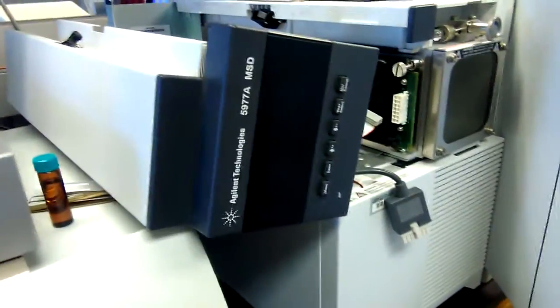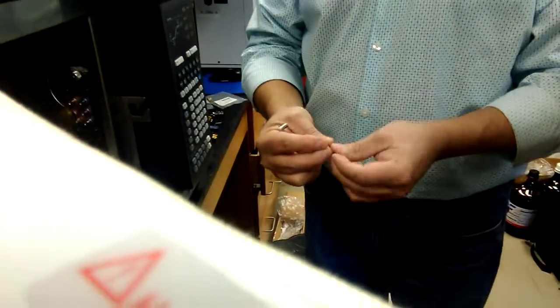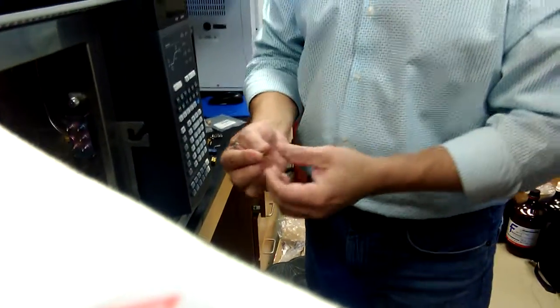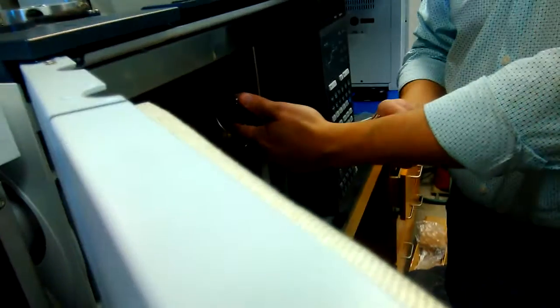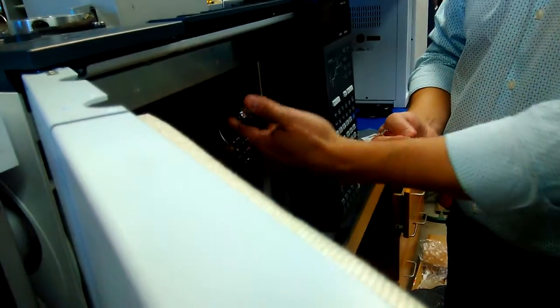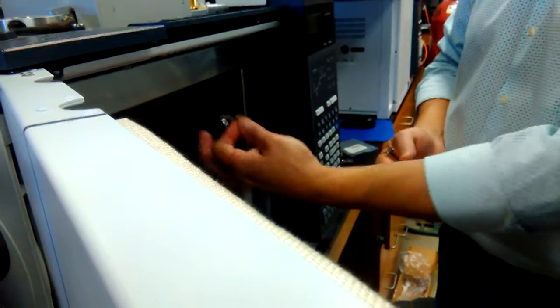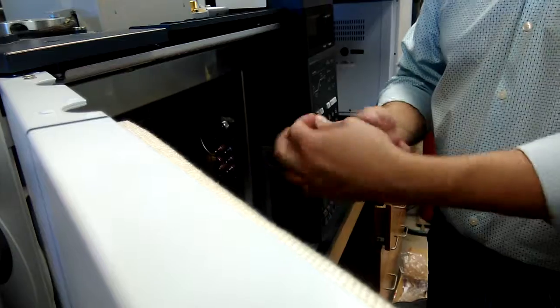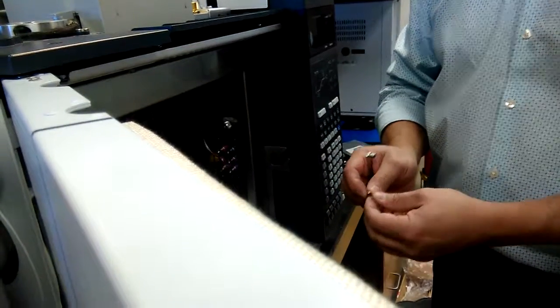So there's these other ones, I have this whole wire, okay? These are just plugs basically. They're not important until you don't have one, because say I'm not going to use the FID long term or it broke. When I remove the FID I want to plug it, that way it's just not an open hole, okay?